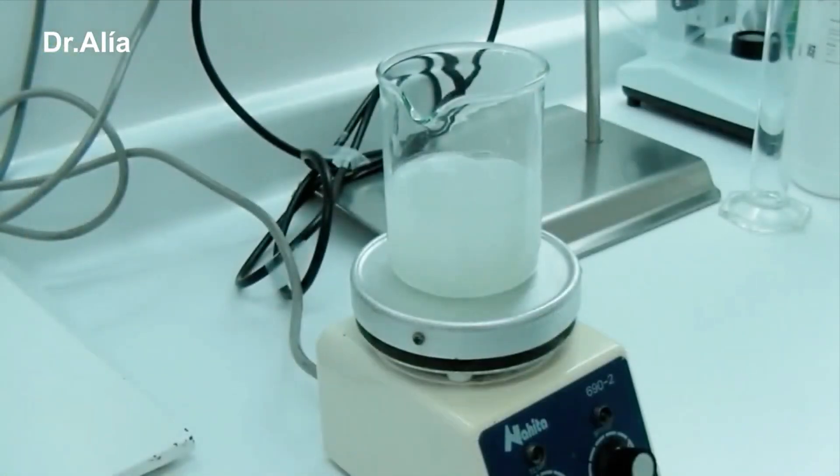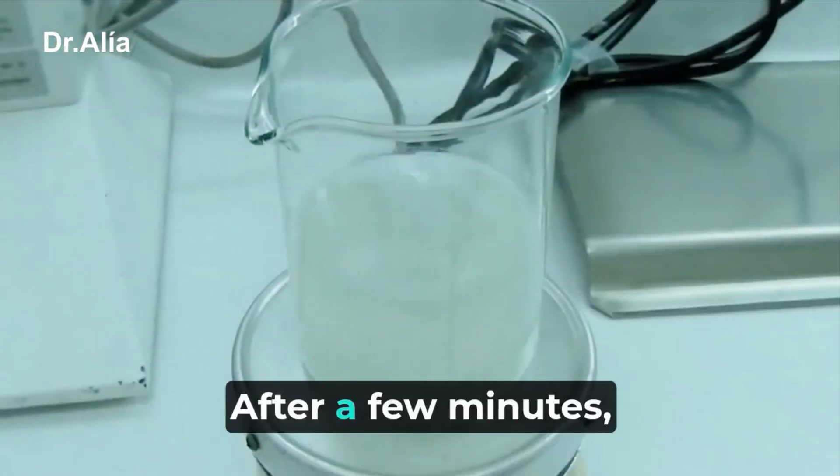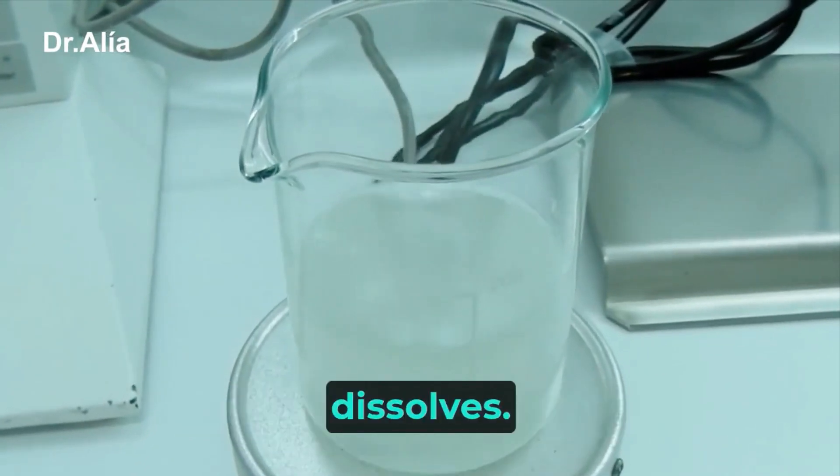Stir at high speed. After a few minutes, the minoxidil completely dissolves.